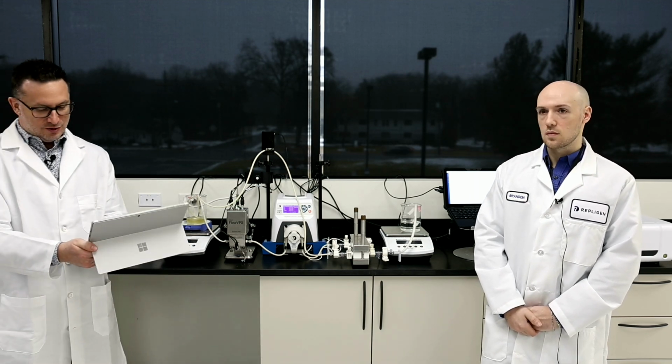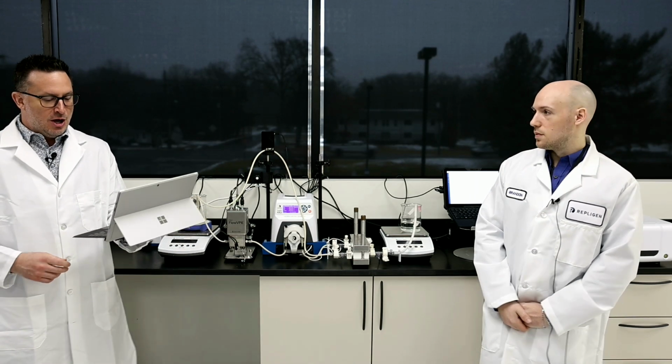So first question that I have here, will A280 and A260 work on the system? Yes. So what's nice about the FlowVPX and with the KR2i RPM software, you can do multiple wavelengths at the same time. But we also have a software called Viper, which is the software that controls just the FlowVPX, which can do up to 10 wavelengths at the same time and even do spectrum scanning if you need to.